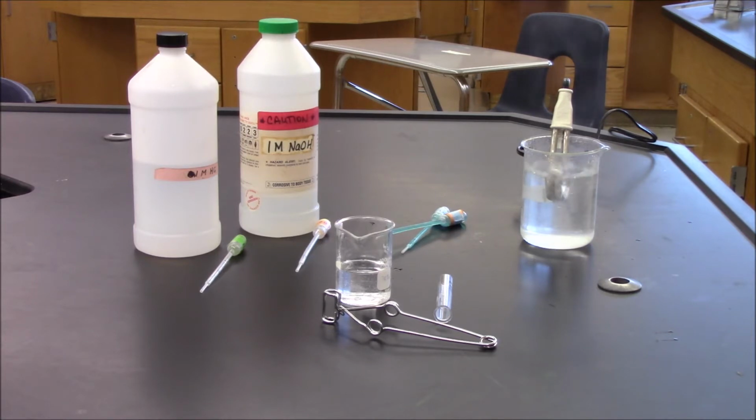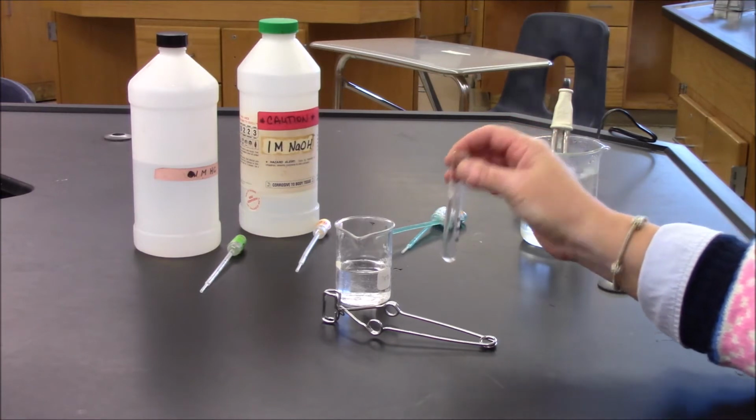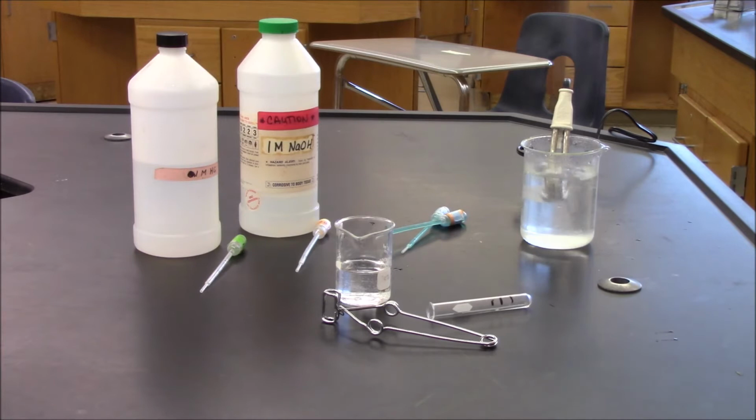All of the reactions will take place in this same small test tube. At each step, we will look for evidence that a new substance has formed as a result of the reaction that occurred. We will also make observations about energy changes and relate them to chemical changes. So in front of me I have almost everything that I need. I'm missing a piece of aluminum foil, but at some point I will run and grab some so that we can finish making our observations.